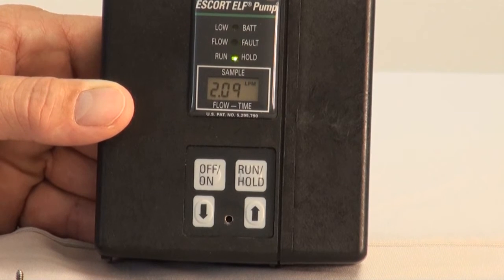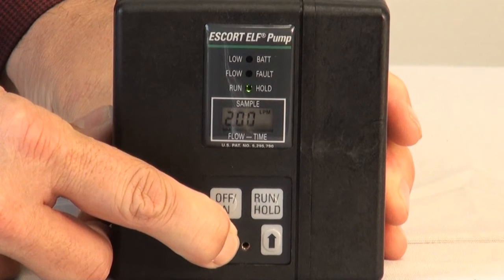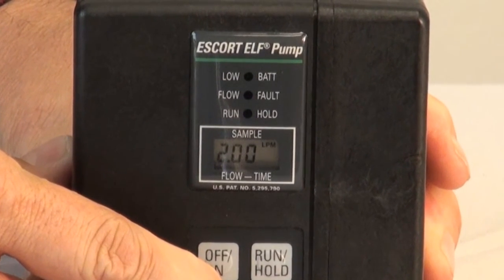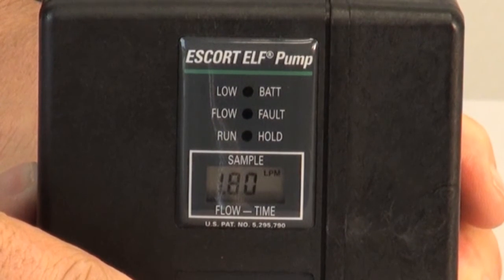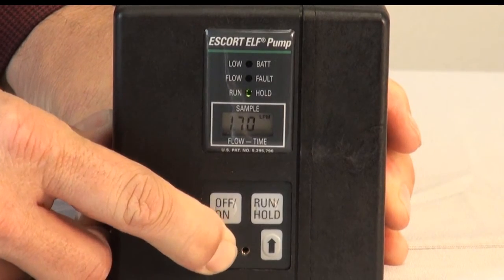After the pump reaches a set rate, you can readjust the flow by pressing the up or down arrow buttons on the control pad. Press the down arrow to lower the flow or the up arrow to increase the flow. The flow rate changes will be visible on the LCD screen as it adjusts in one-tenth of a liter per minute increments. When your desired setting is shown on the LCD screen, simply discontinue pressing the button. The new flow rate is now set.